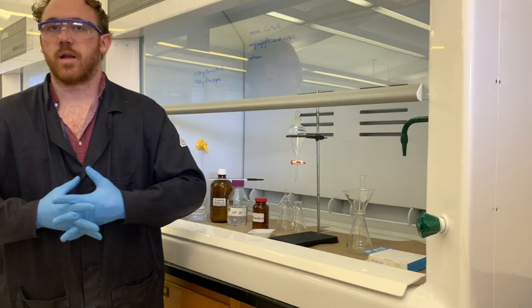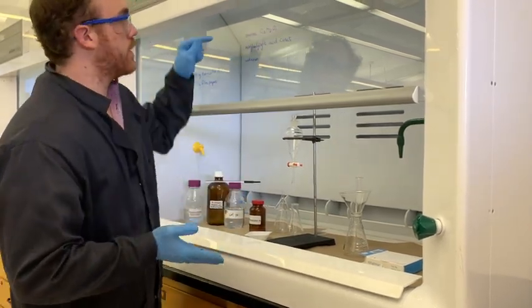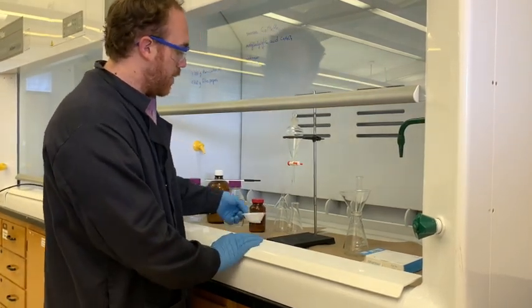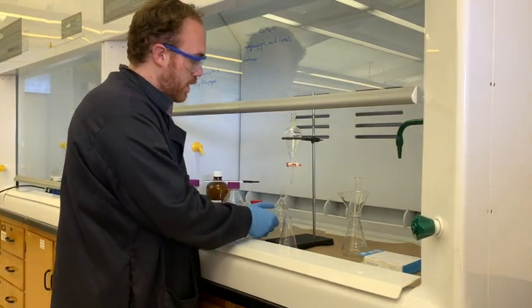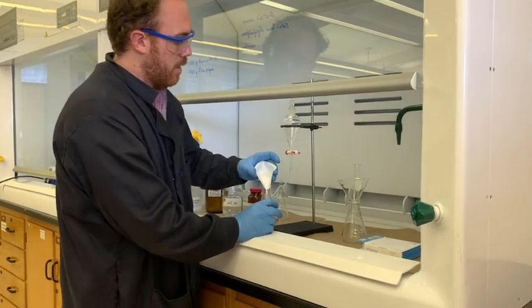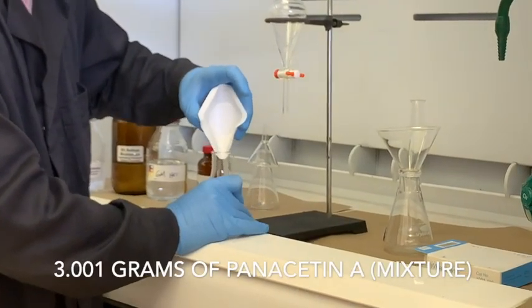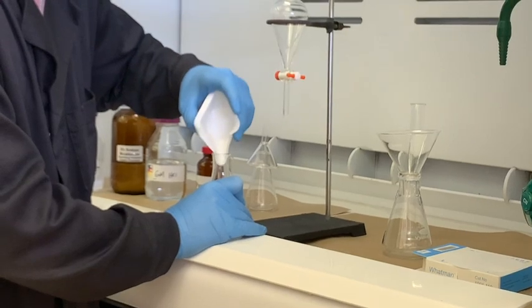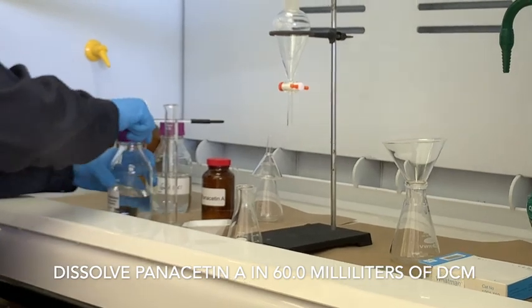You can look those up in your lab manual. We're going to start with the isolation of the sucrose by taking this mixture and putting it into the Erlenmeyer flask with a little bit of DCM. I have 3.001 grams of this weighed out, and we're going to need about 60 milliliters of DCM.